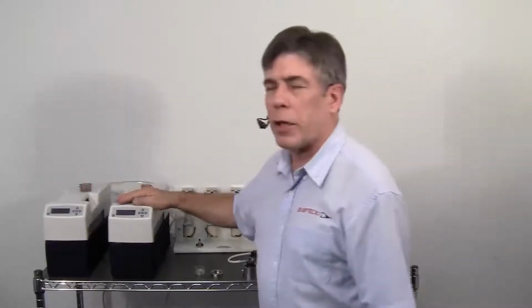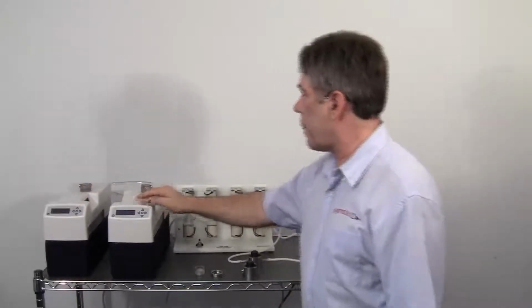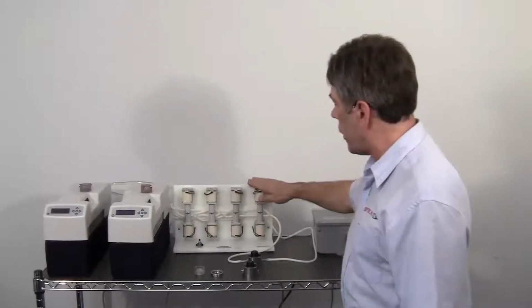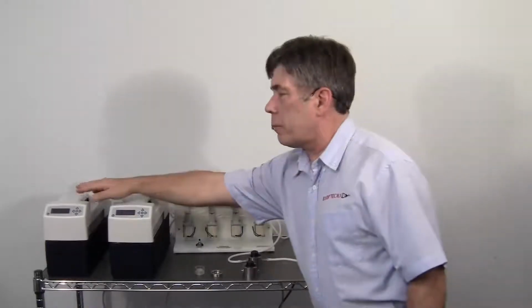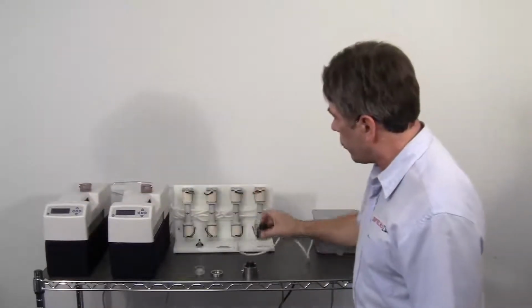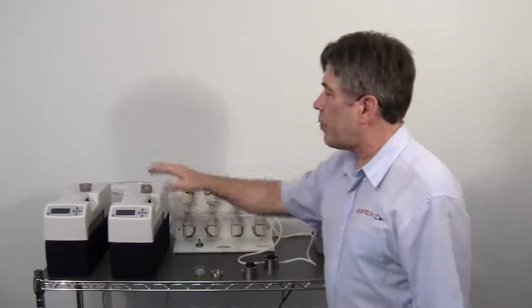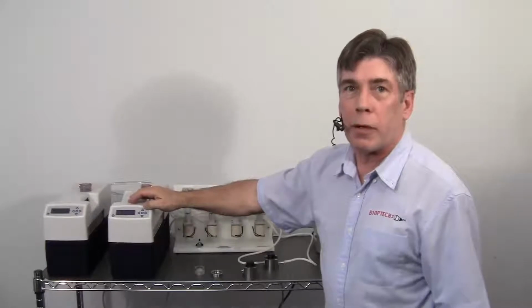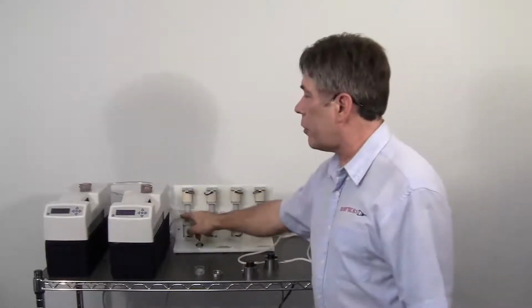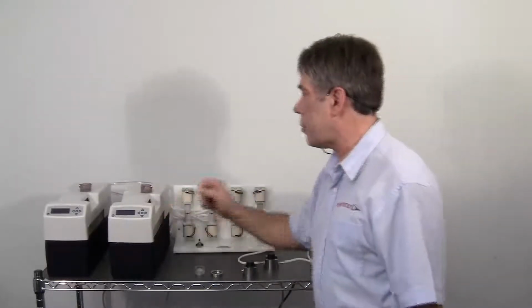Now we're using two nanotherms, therefore the temperature on each can be set separately. The flows from each of these individual nanotherms goes through a little network of relays where the fluid flowing from temperature source A, for instance, will pass through the worm embryo chamber and then back to itself to maintain recirculation. All the time, the second nanotherm, which has to remain running for your second temperature source, is also short-cycled through the solenoids to allow this system to continually recycle and maintain its stable temperature.